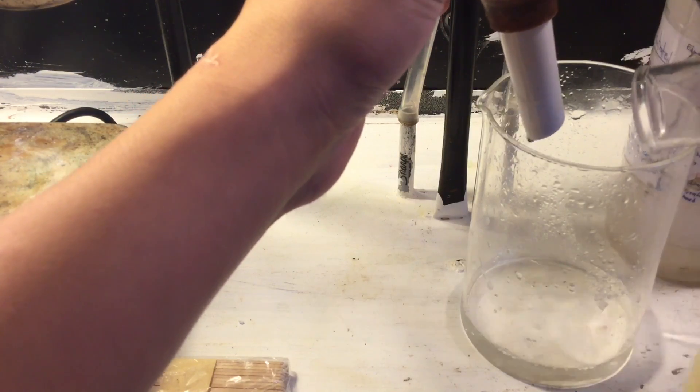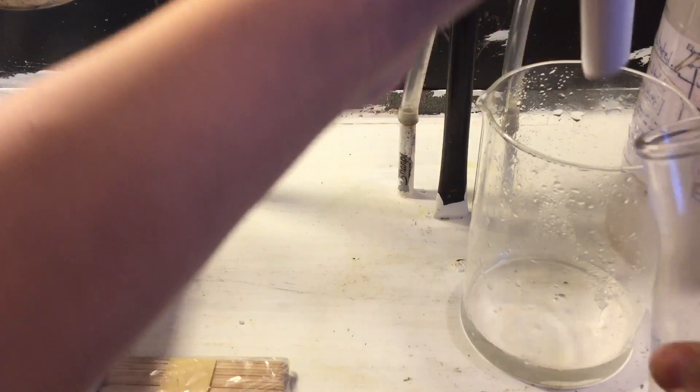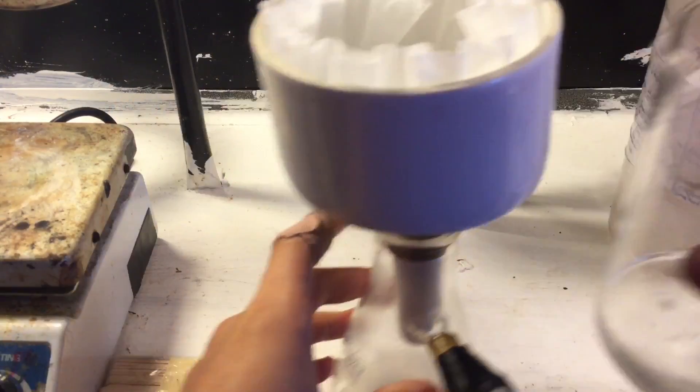Now, you could take the filtrate and also boil it down further, which is what I did, but it yields a less pure product. But that's fine.